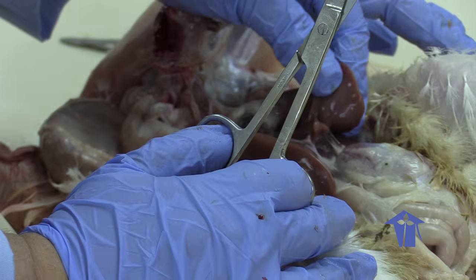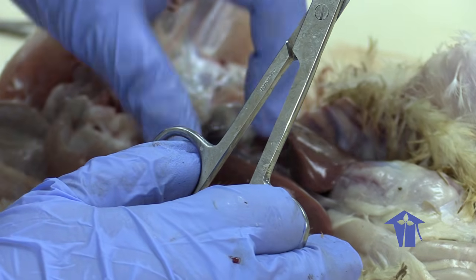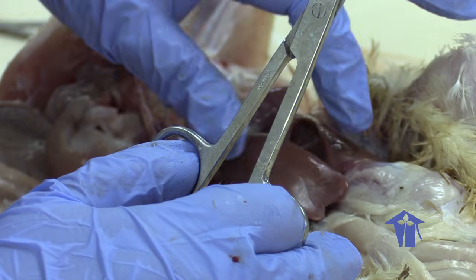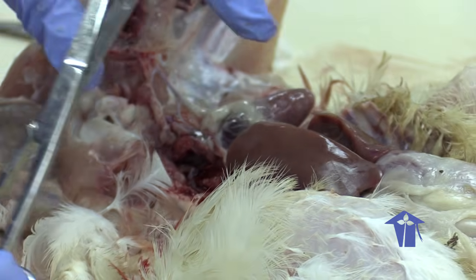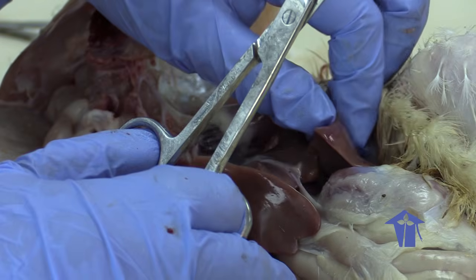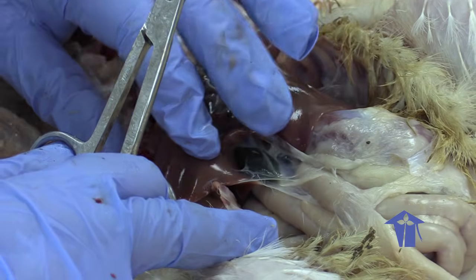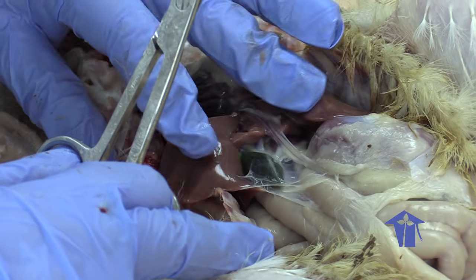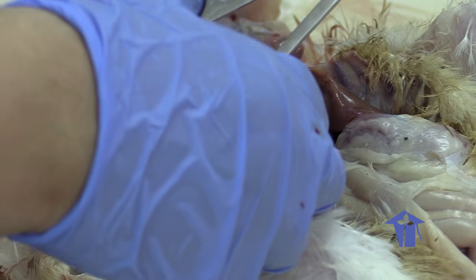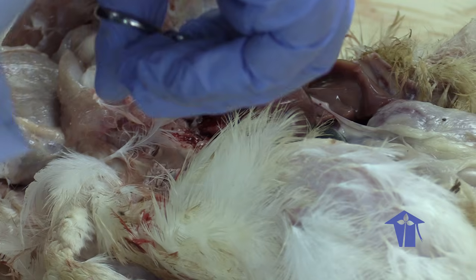It will always be lobed with smooth, rounded edges, and it's always very dark in color, partly because of the blood running through the liver, and partly because of all of the bile. If I were to move the liver back, you would see a green-tinged sac. Oopsie, that is the gallbladder. Cut here a little more.